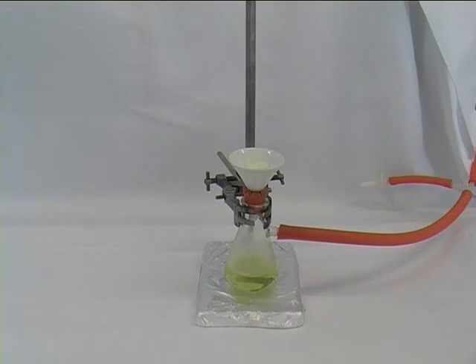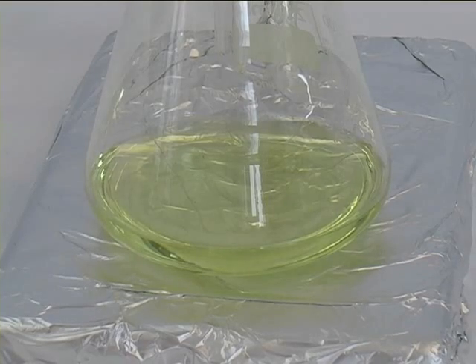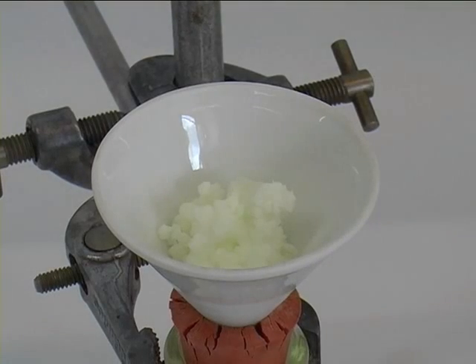Once you have done that you will be ending up with a solution in the Buchner flask and your magnesium sulphate in the Hirsch funnel.